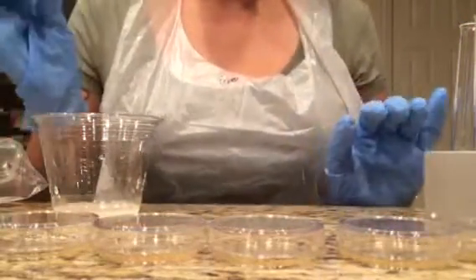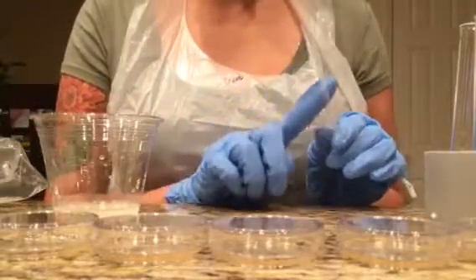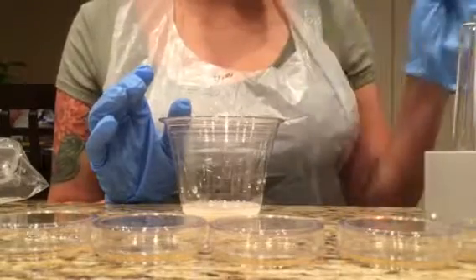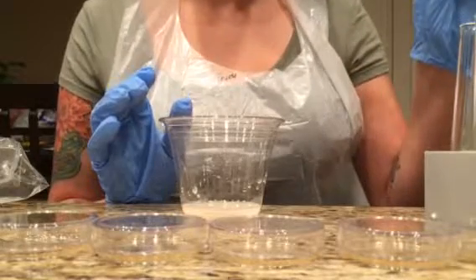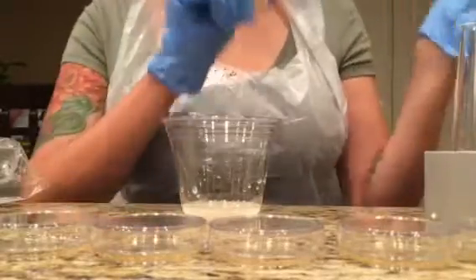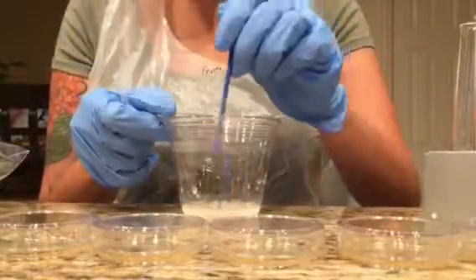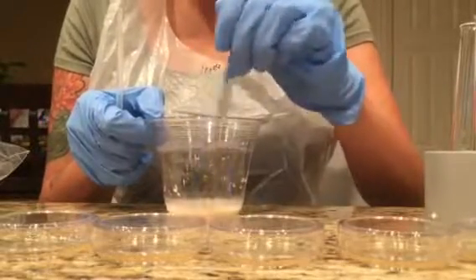So after I have all the water filled, it asks for me to get 0.25 milliliters of the yeast solution, and then I will pour that into the test tube 1, and then from there I will start transferring the solution onto the tubes that will be in the numerical order after that. So to start off, I will go ahead and mix the solution. Make sure that it is all dissolved.